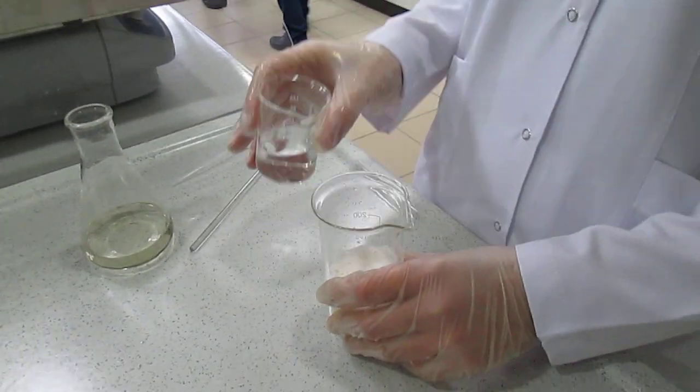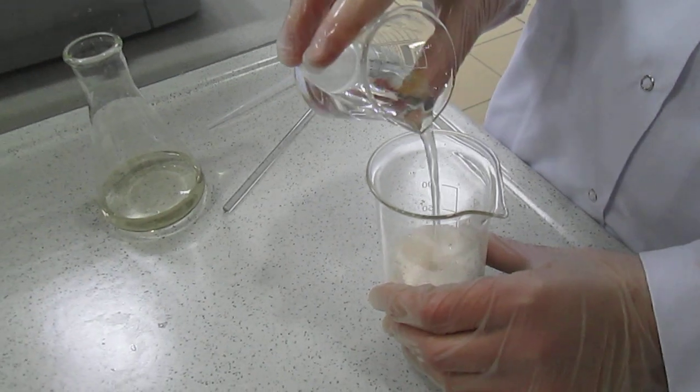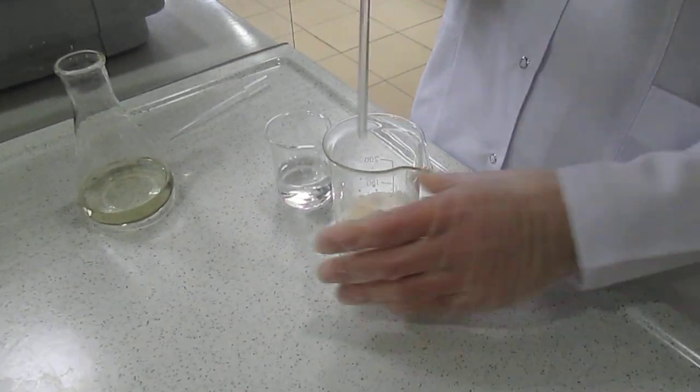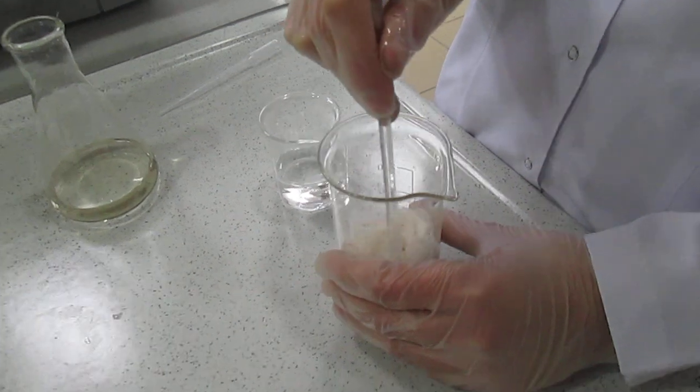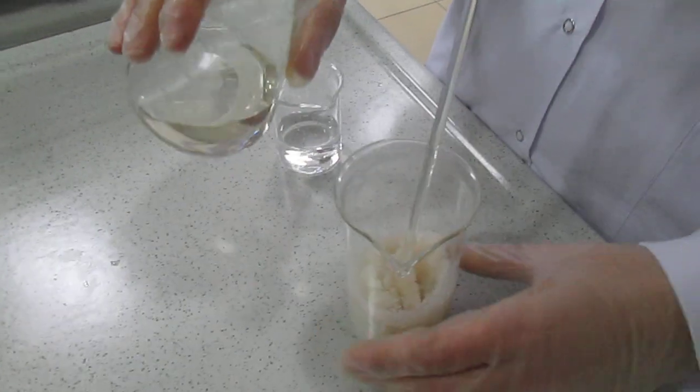First we add water into the sugar and sugar is dissolved with water. Then concentrated acid is added.